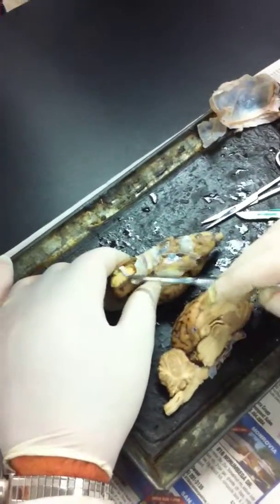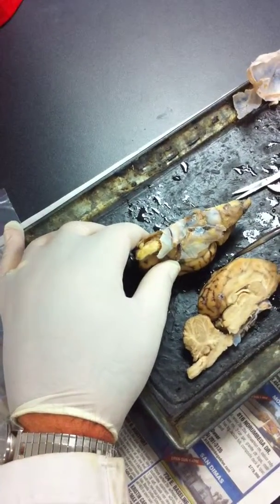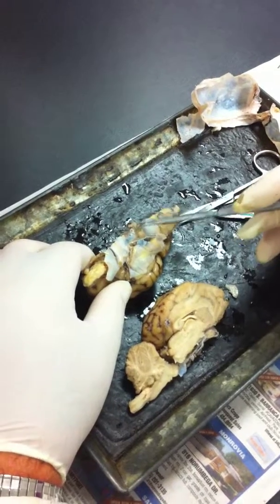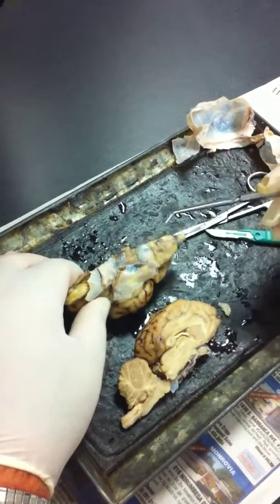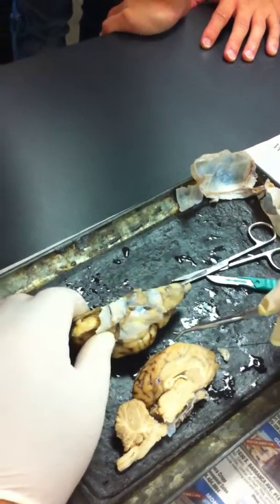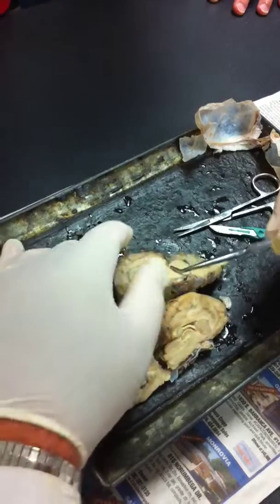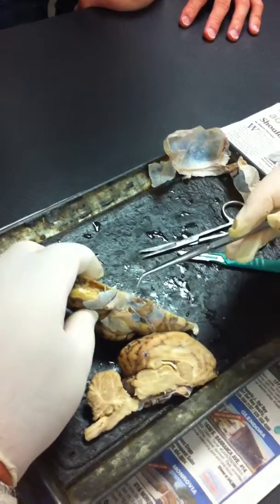What's this again here? Oh, the olfactory bulbs. Yeah, olfactory bulb. What's this? And this? Yes, and this? No, no. The abducens is tiny. Oh, yeah. This is the abducens. Oh, trigeminal. Is that huge, that big? Oh, yeah, you should be able to see three divisions. Anyway, I won't try to find them. Okay. I think that's it.